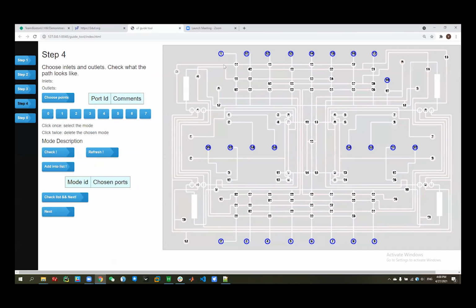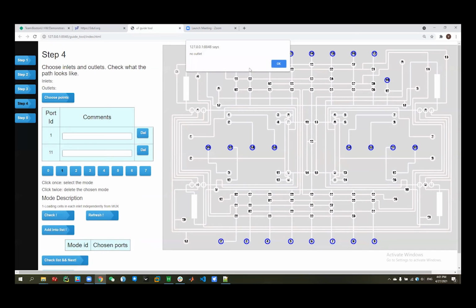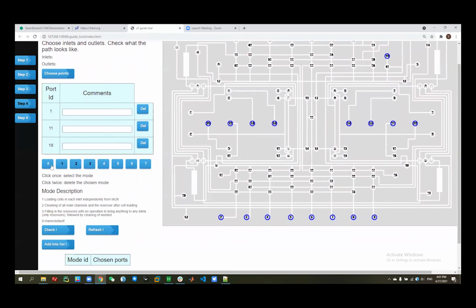So we can just choose point 1, 11, and we don't choose 18 or 20 because we don't need any outlet. And just to see what will we get. So it will have a logic error and say there is no outlet. So we need to put in an outlet. 18 is the outlet. So maybe we can do a sequence of operations together.